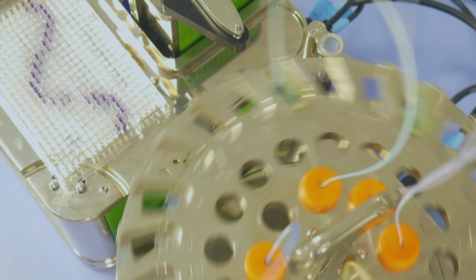The plate definition file contains the geometry of the output plate. If you've used this plate before, you don't need to worry about this. If it's a new plate, drag this folder to the plate definitions folder. Then you can open the Mantis software. The Mantis will start initializing, doing its stretches, and spinning the carousel if you have it, which will detect the position of the RFID chips.